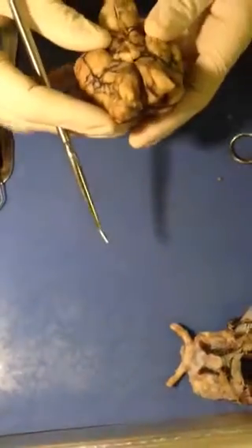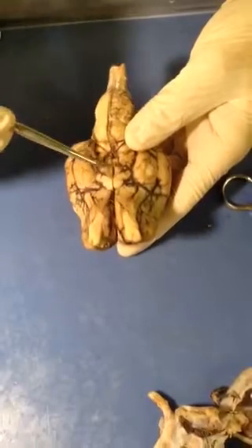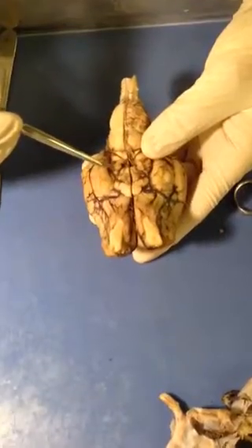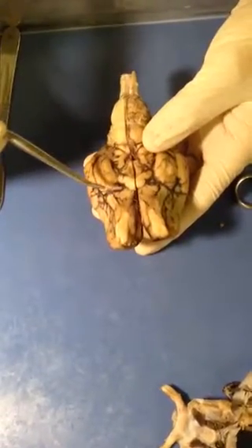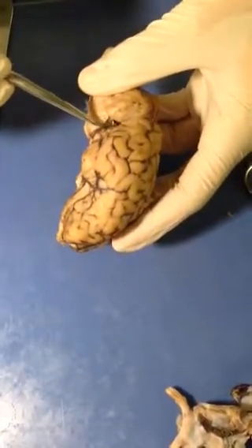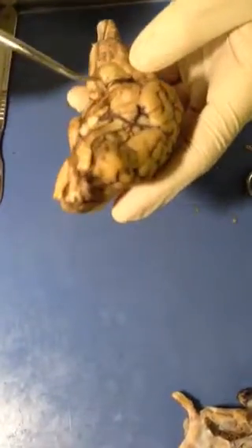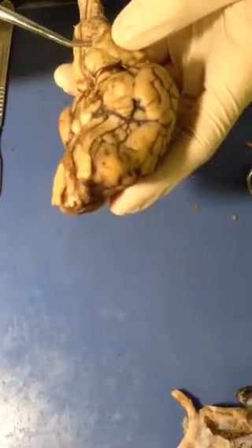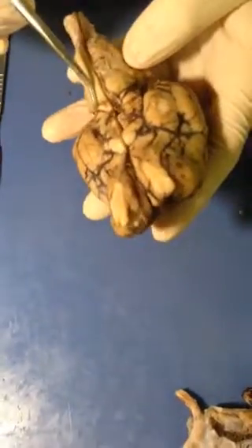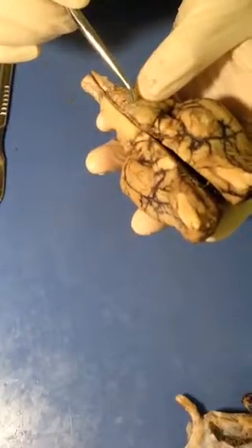We have a couple nerves that are visible. We'll put this back together so you can see. Right here, we have these two little things on each side. Those are the oculomotor nerves. And then on the sides here, you can see that little nerve there. That is the trochlear nerve. And down, coming out right between the medulla and the pons, would be the abducens nerve, right there.